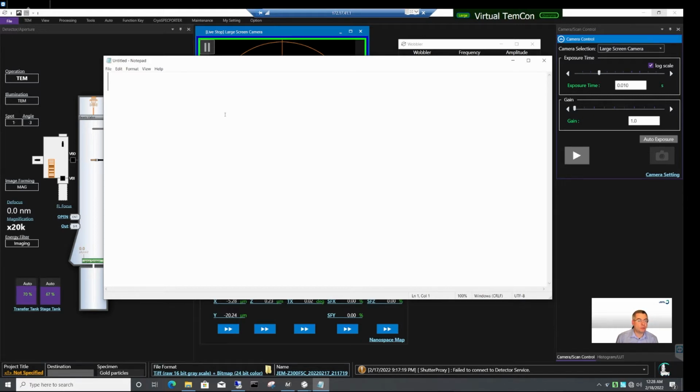We have Notepad open. In this case, the first thing that we want to do is import tkinter. Tkinter is a very simple graphical library. It ships with Python. You don't need to install it. There are no licensing issues attached, so everyone is free to use tkinter for commercial or non-commercial applications. And the other thing we want to do is import the TEM3 class from PyJEM.